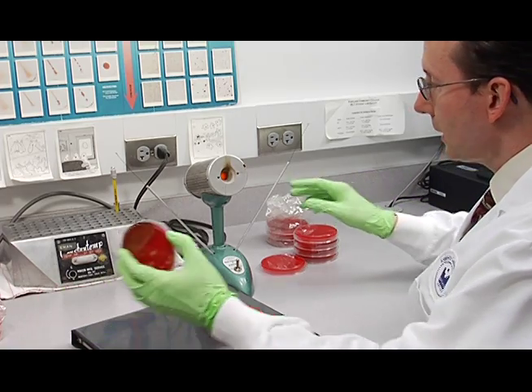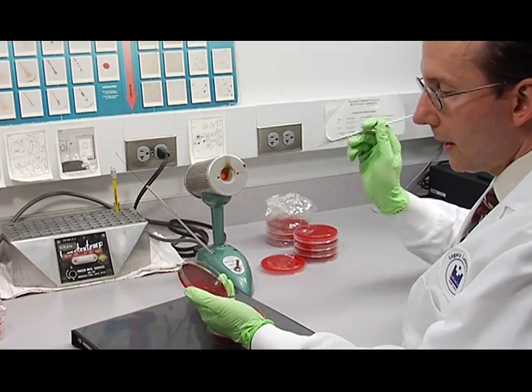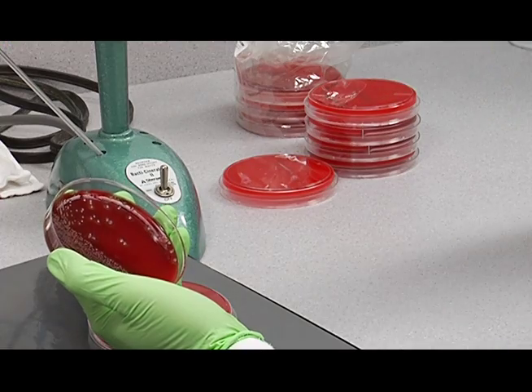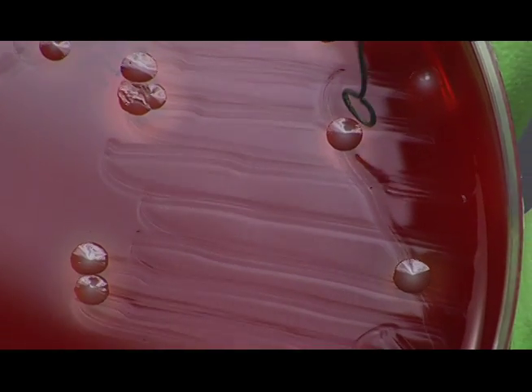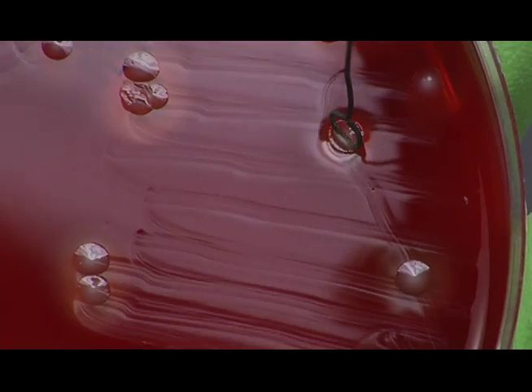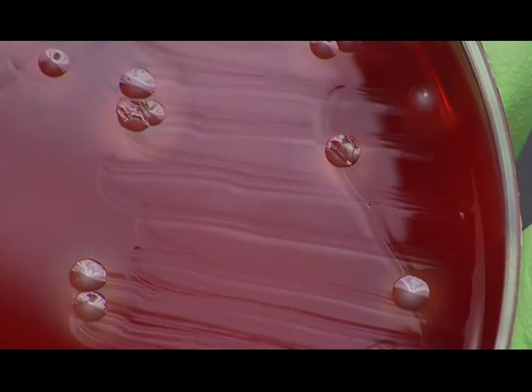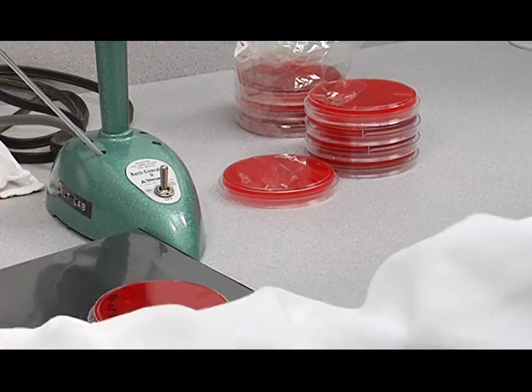Then obtain your inoculum. Just barely touch one of those colonies. There you go. And that will be plenty.